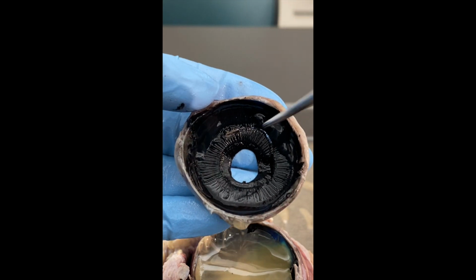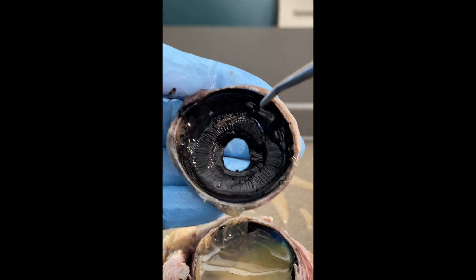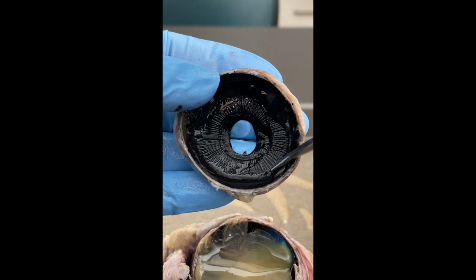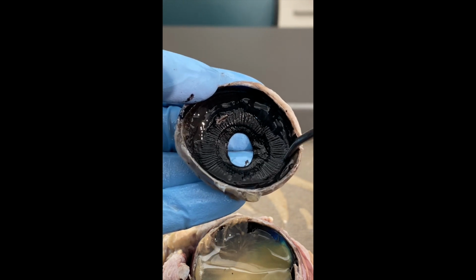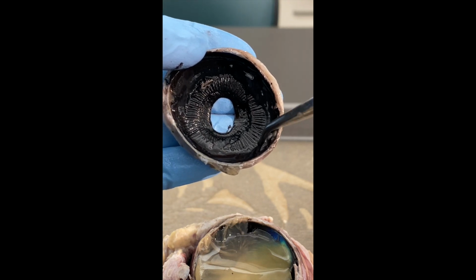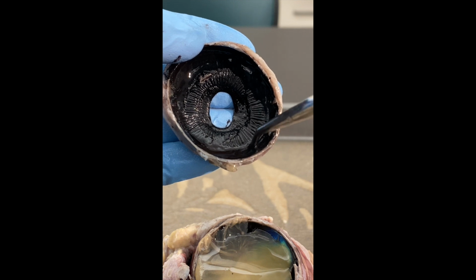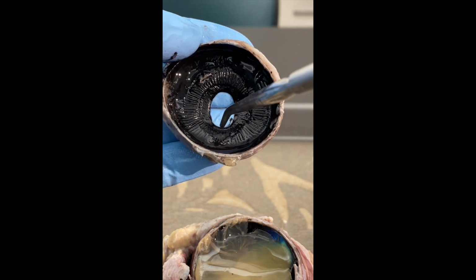So the chambers are only found in the anterior cavity, and you have two major cavities of the eye. We're looking at the back portion of the anterior cavity. Now the outer perimeter, or the outer edge of the ciliary body that runs all the way around, kind of like a hemline, is called the ora serrata. So the ora serrata goes all the way around.